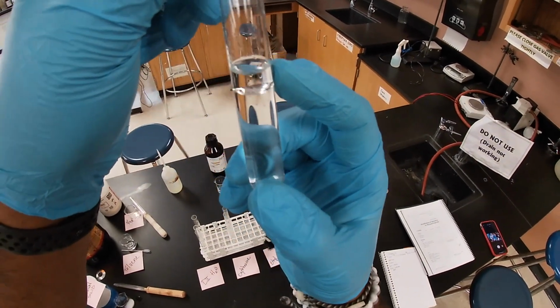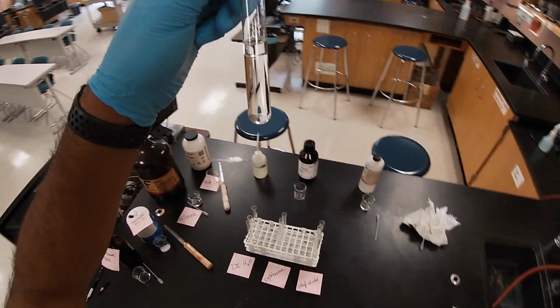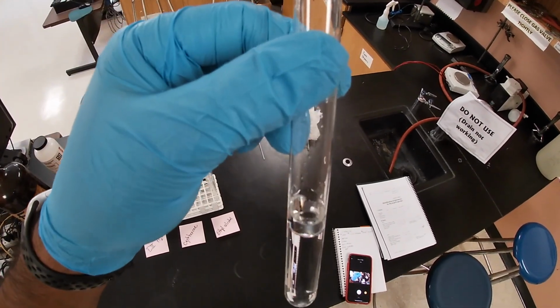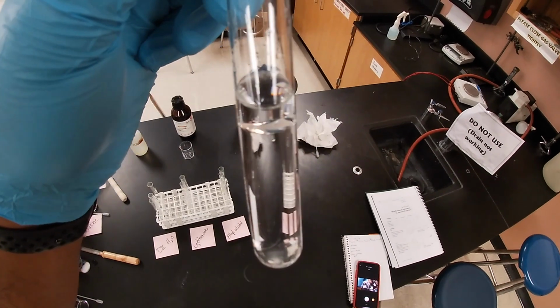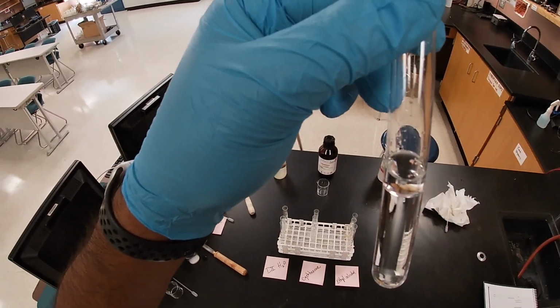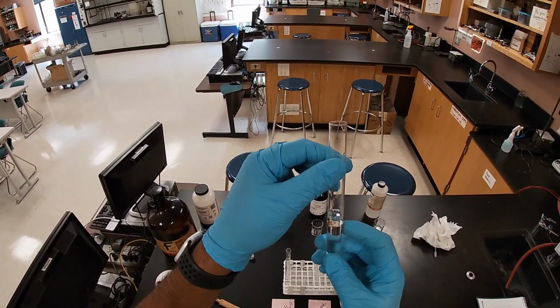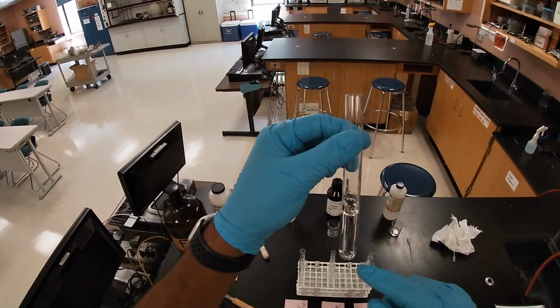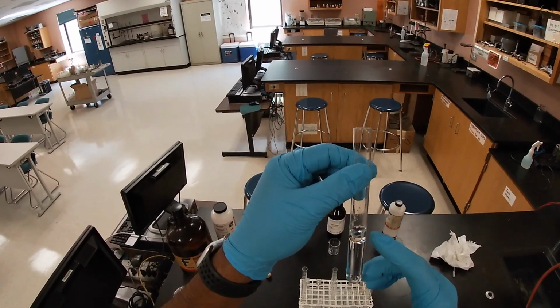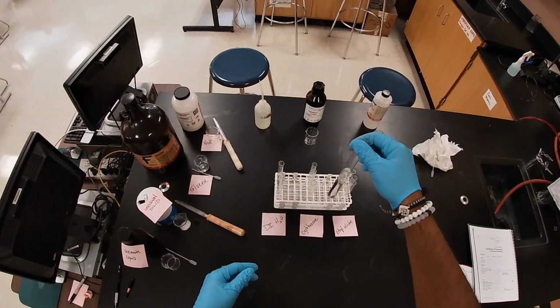Let me zoom in some more. Just give me a second. Gotta check out my camera here. All right, we can see the two layers there. The top layer is gonna be your toluene. That was a lesser amount that we put. So what this is indicating here is that based on density, these don't mix at all whatsoever, right? Even if we shake them, right?